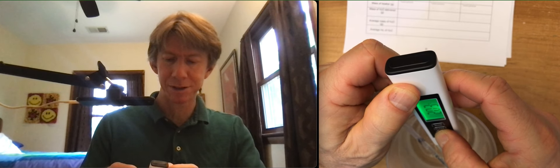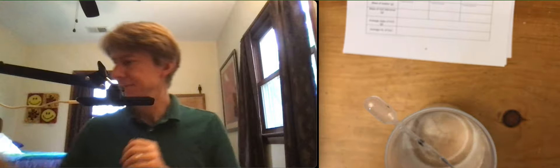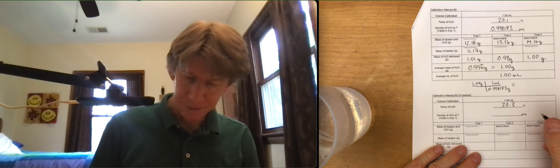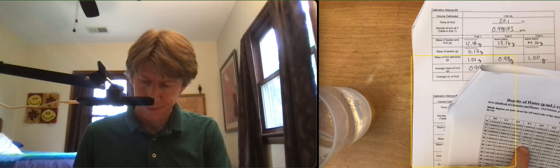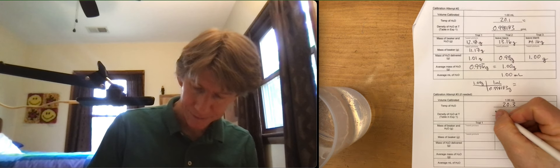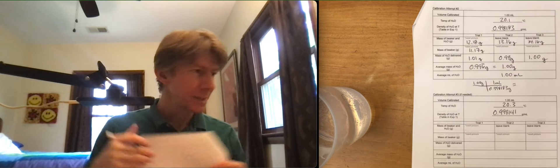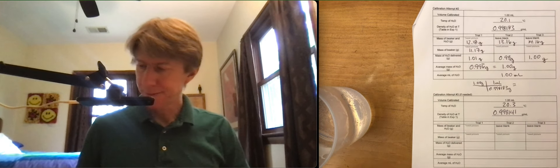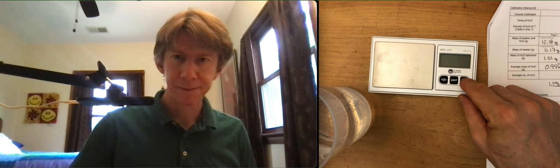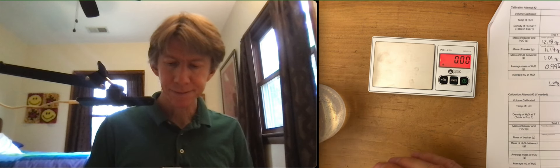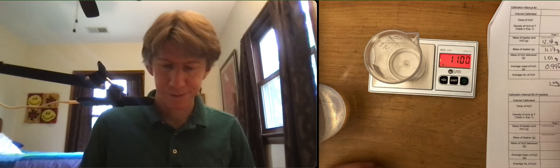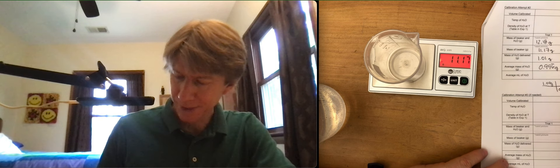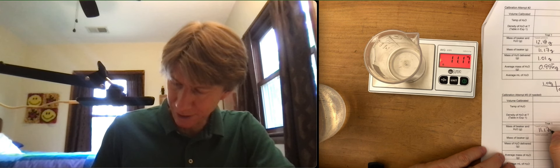Always write that down. Density at 20.3. 0.998141. And now let's do this. Got my scale. Oh, still got my water in it. Let's pour that out. Didn't have to actually, but the instructions do say to do that. The experiment works. Anyway, this time we've got 11.17 grams. I don't know why this table, I did it this way. But I guess the subtraction was easier.